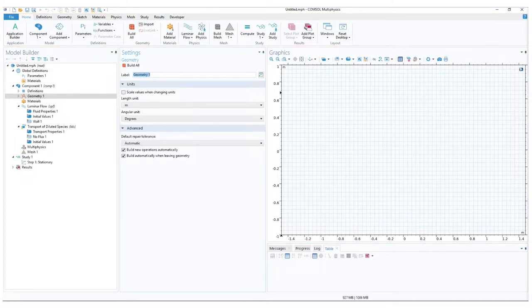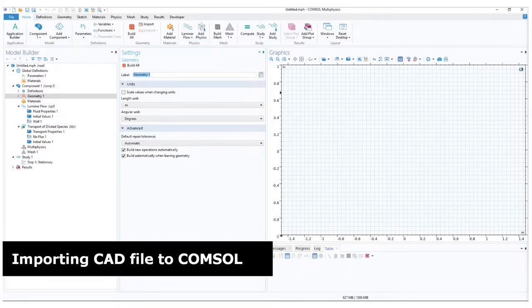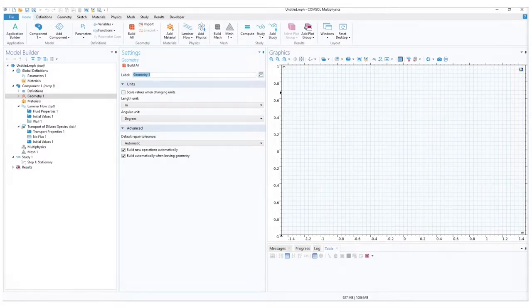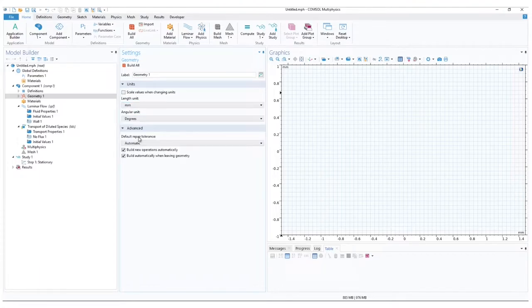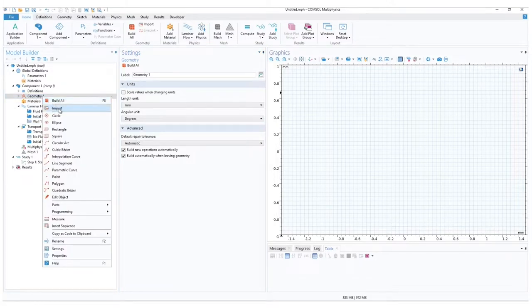Going back to the task. Before we import, we need to be aware that the drawing file does not come with specified units, but in absolute units. This means that depending on the COMSOL geometric base units, the model will also take this scale. As we have the geometry already open, let's change the length unit into millimeters. In the model builder under component 1, right click on geometry and select import.